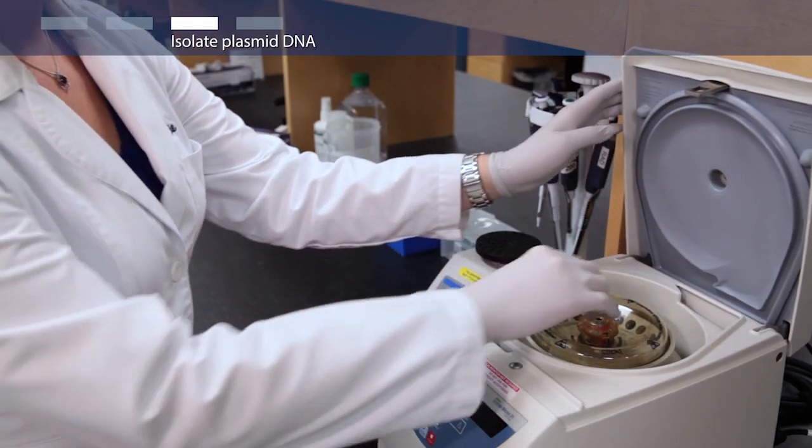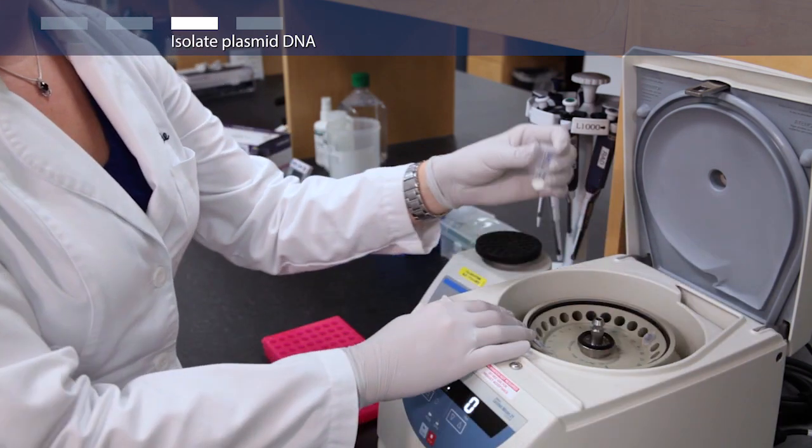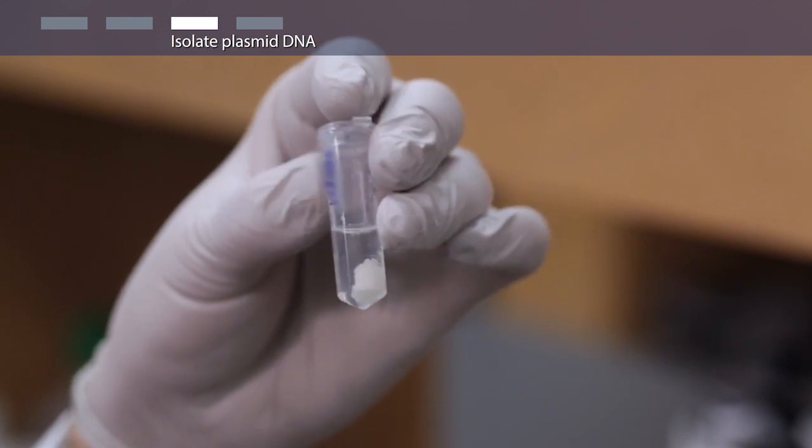Centrifuge for five minutes. The cell debris and chromosomal DNA will form a pellet.